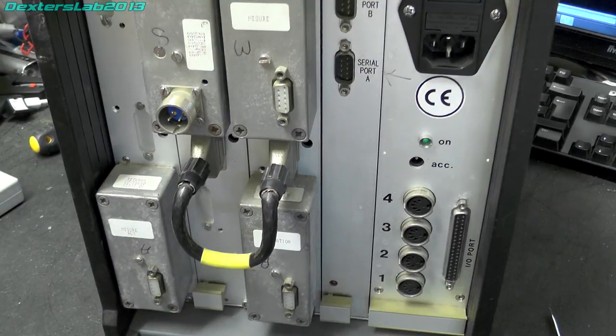It could be the text strings that we saw in the EEPROM might have come out on a separate port somewhere. Maybe there's a diagnostics port or something in there internally. But yeah, shame we didn't have the science element to this, because the calorimeter I think would have been a really, really interesting thing to take apart.